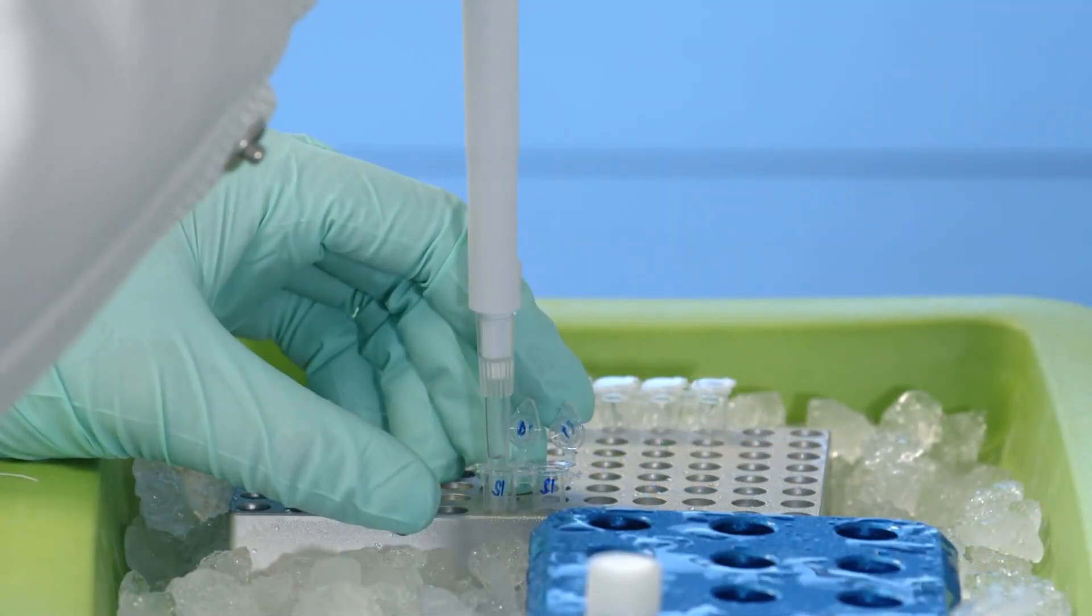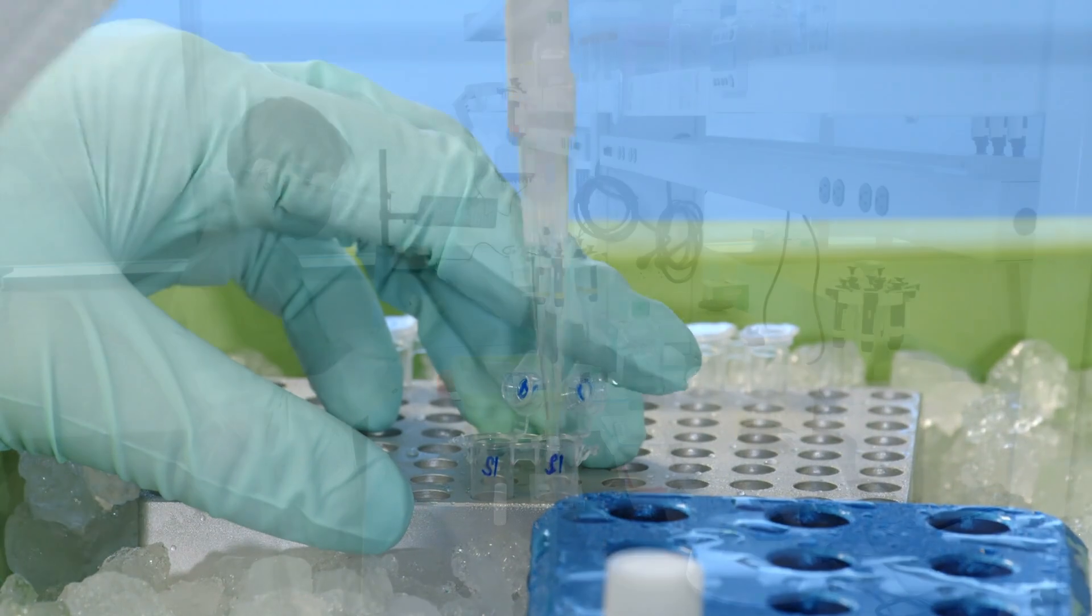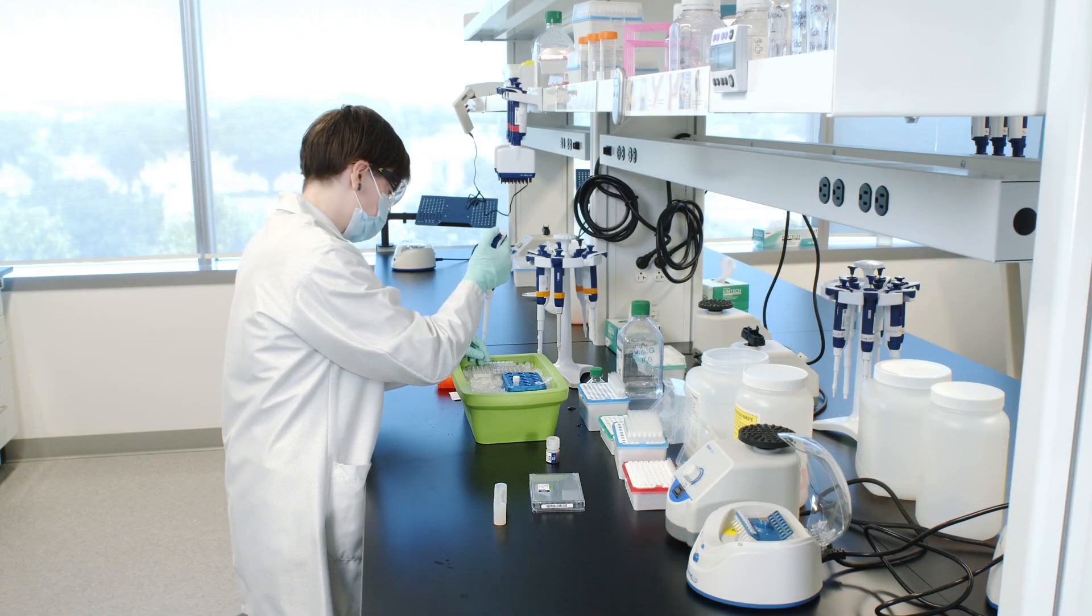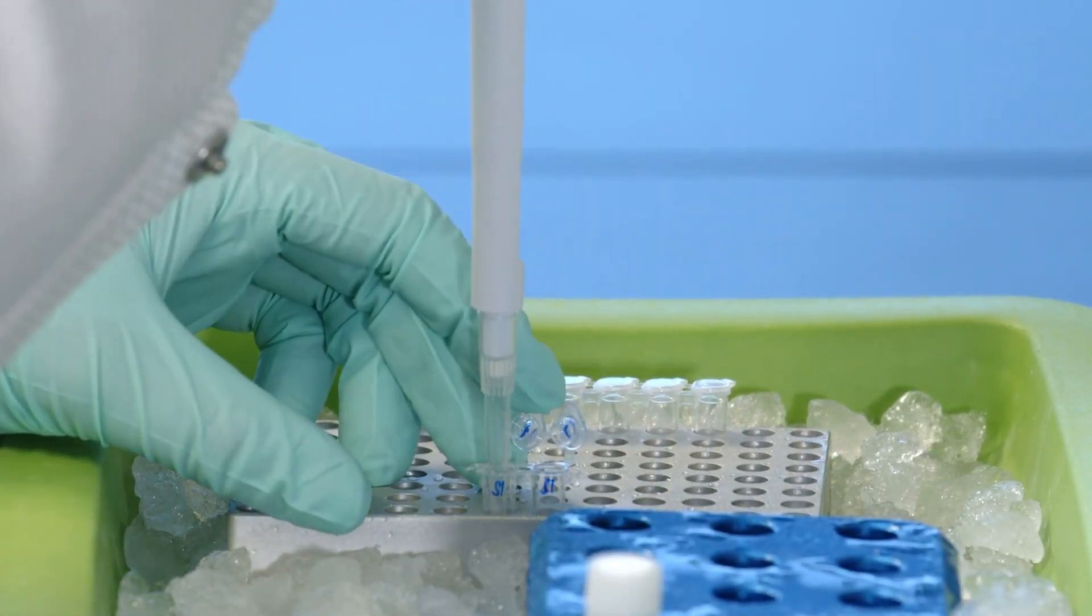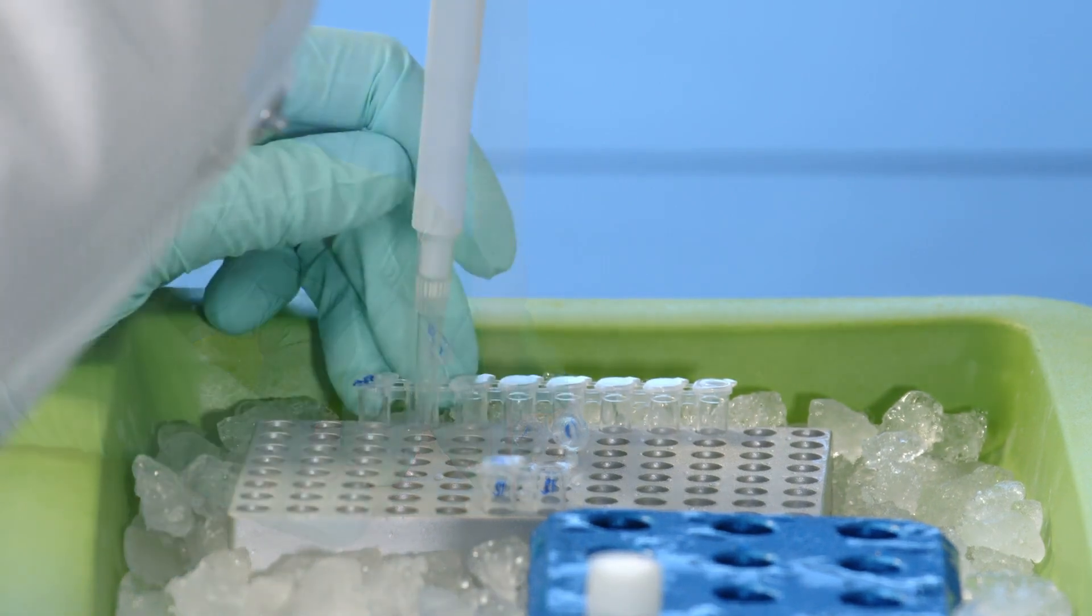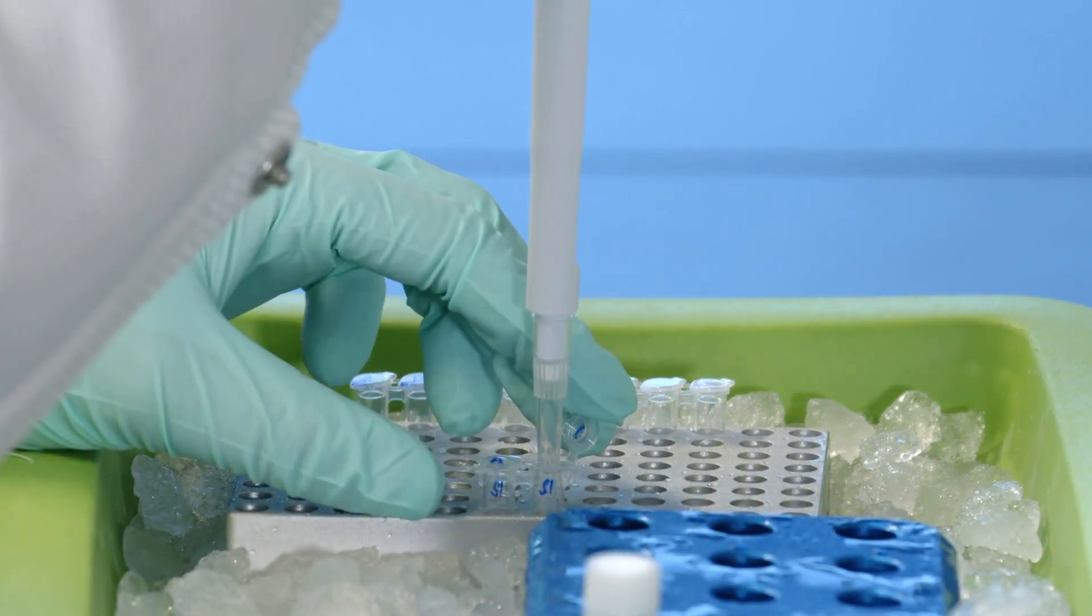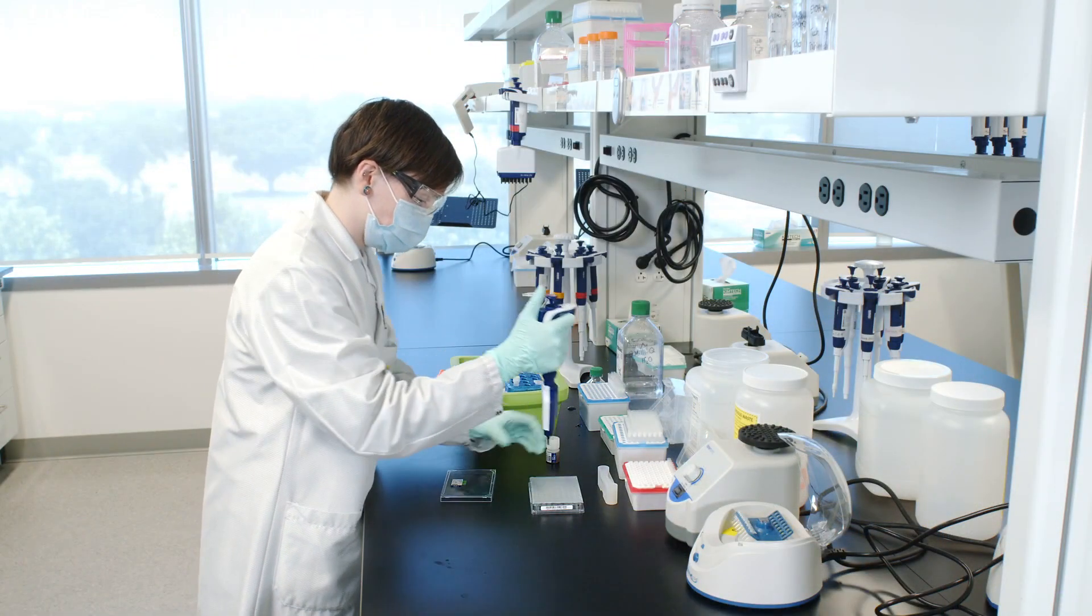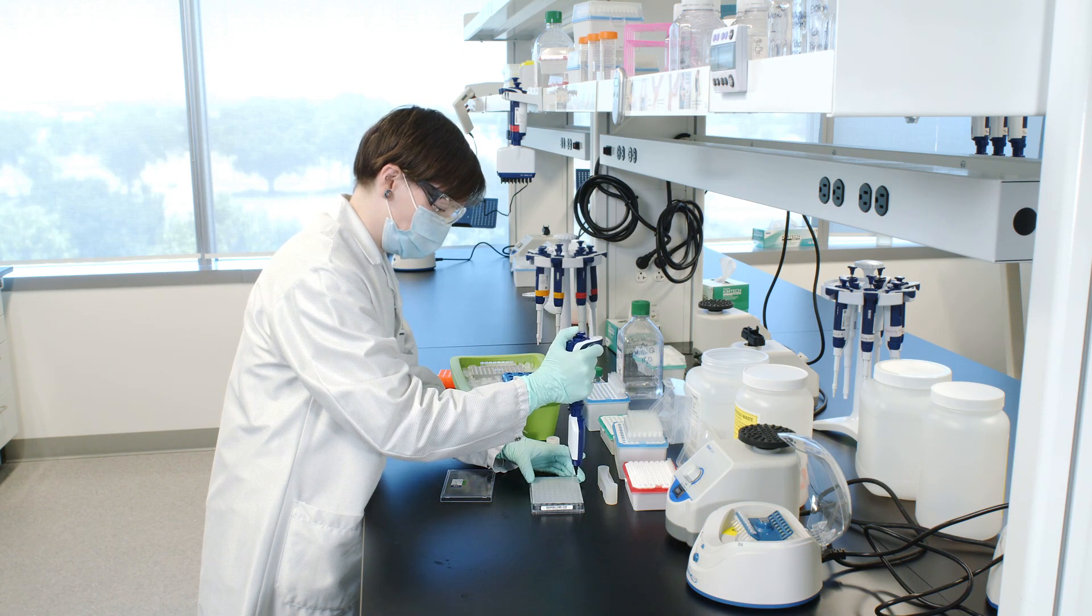Add 25 microliters of each sample from pre-amplification to a separate tube previously aliquoted with amplification master mix. Add 5 microliters of an individual dual index TS set A to each tube and record the well ID used. Pipette mix and centrifuge briefly.